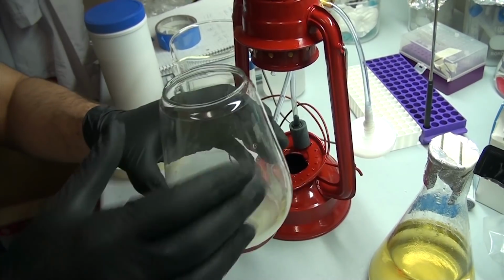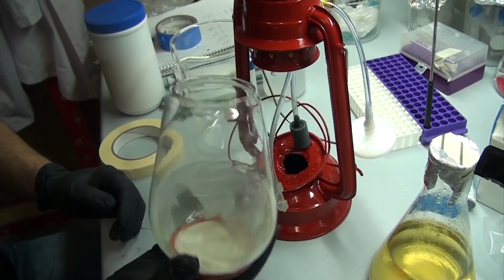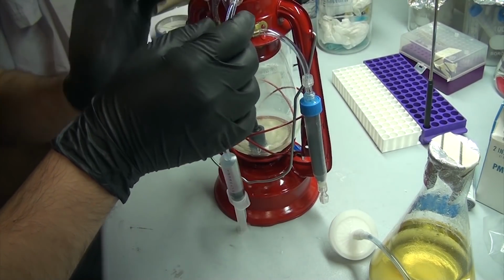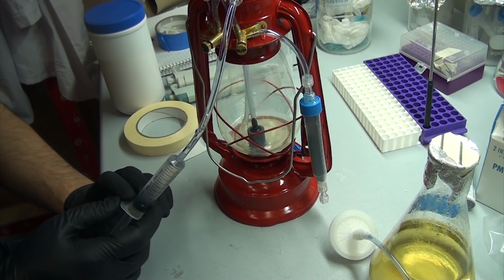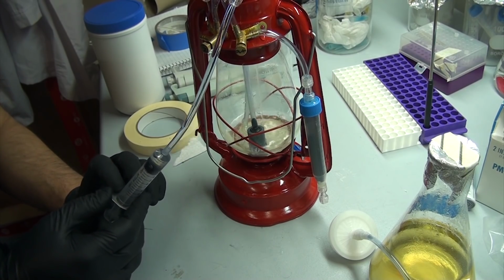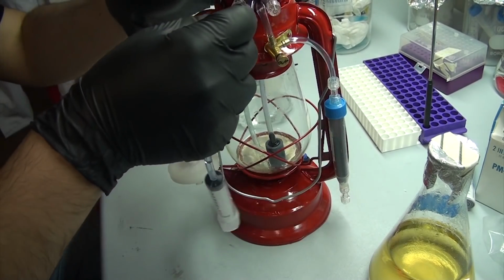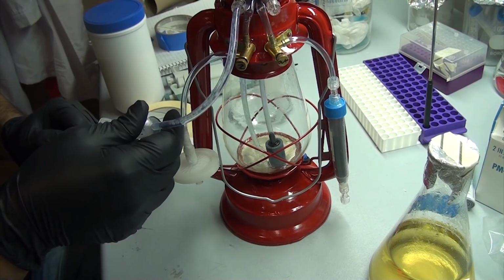To get everything ready for bacteria, this needs to be sterilized, so I used hydrogen peroxide to flush all the lines, and clean the inner chamber. I chose peroxide for this because it's cheap and it's great for killing spores and bacteria, but on contact with the nutrient medium, it'll quickly react away, so that once we add the organism we want, they won't get harmed. You can optionally flush the lines with sterile water if you really want to make sure the peroxide is gone. Once everything has sat in peroxide for a while, I drained it as much as I could so the system was empty and ready for bacteria.